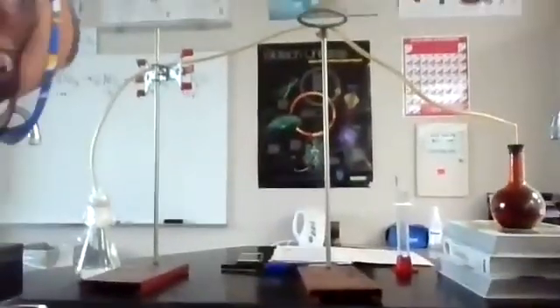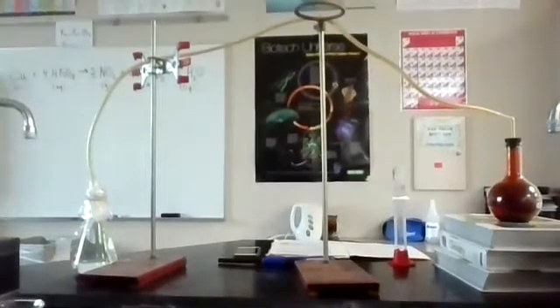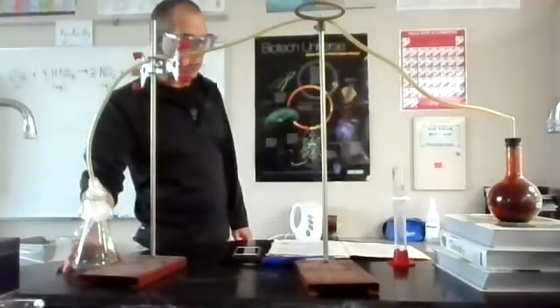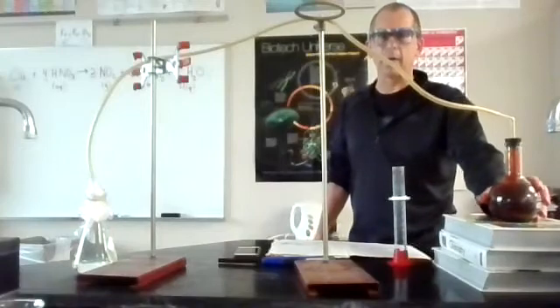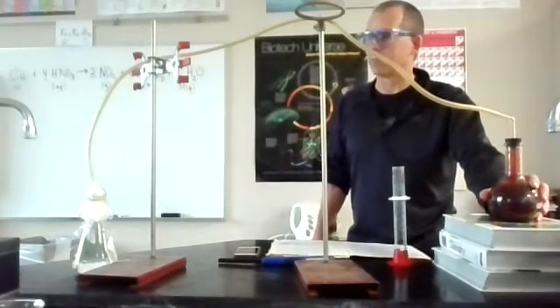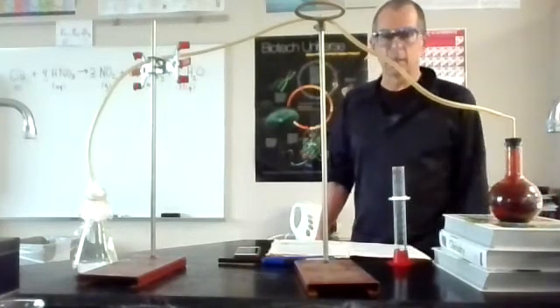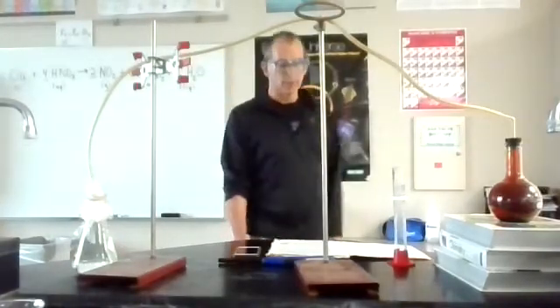Okay, I'm going to put the thing back over here where we were originally. Let's see how this looks. All right, we can see everything right here. It looks like it's almost finished bubbling. This is quite warm right now. I didn't get a temperature of it, but it definitely feels warm to the touch. And that's our reaction. Yet something else is going to happen here.